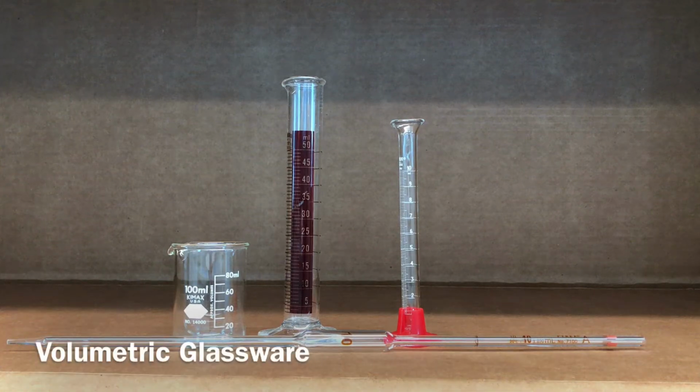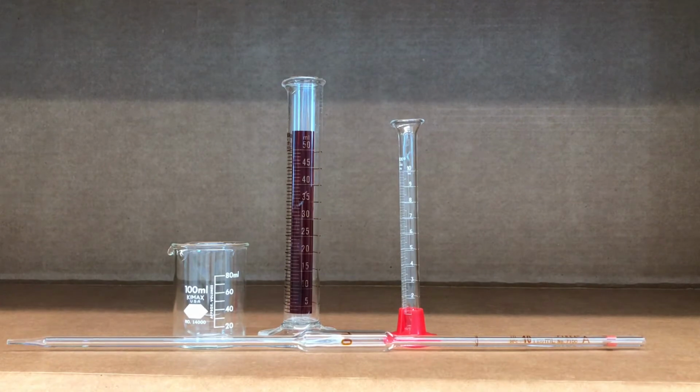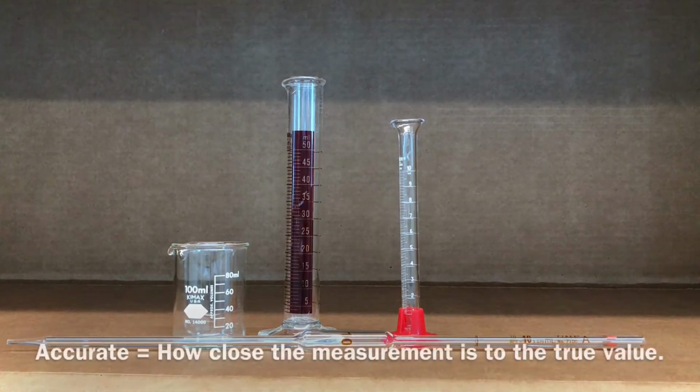Before we get started with measuring liquid densities, part A of the experiment, I want to talk about the different types of glassware that is used in chemistry and why we use certain pieces of glassware depending on how accurate or precise of a measurement we want to make.